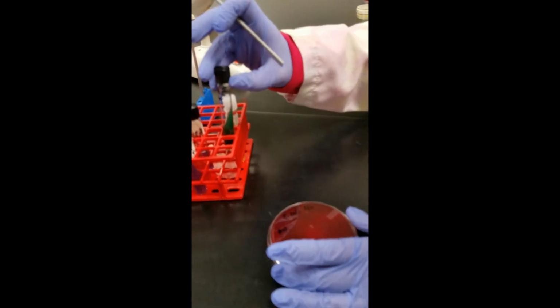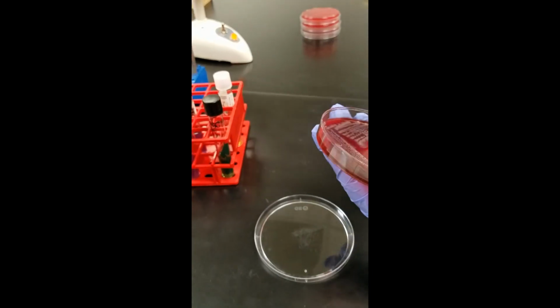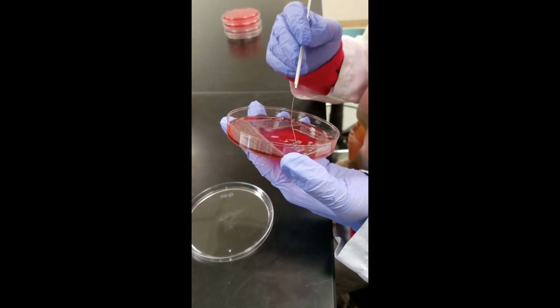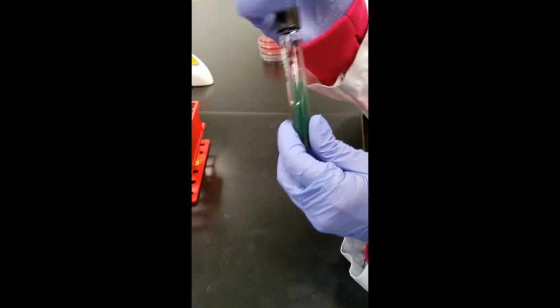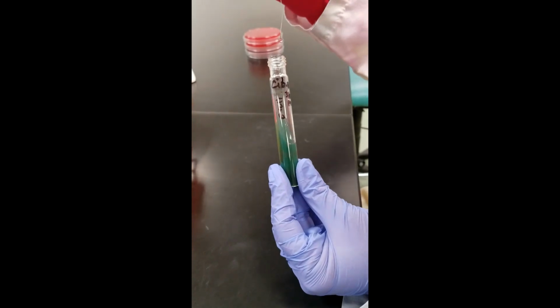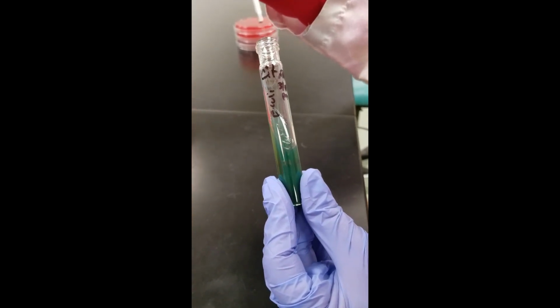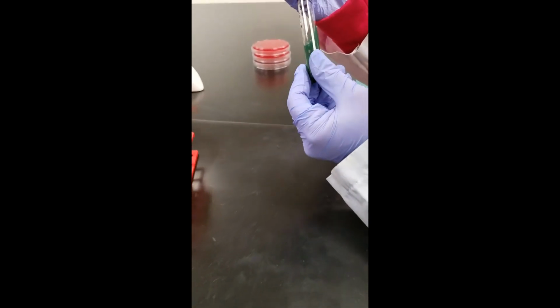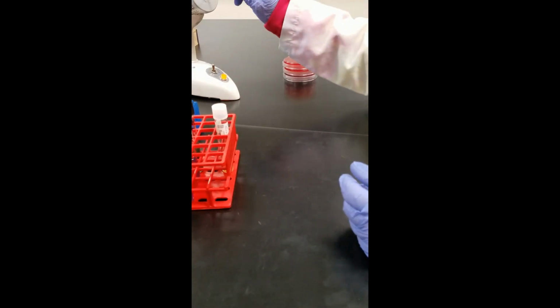The first tube that we're going to set up is called the citrate. It's a nice and pretty green color, but it can get even prettier the next day. I'm going to pick up some bacteria from my plate, and this just gets a zigzag on the slant. So I'm using the loop, no stabbing whatsoever, and I'm just zigzagging up the slant. A loose cap. Incinerate the loop.